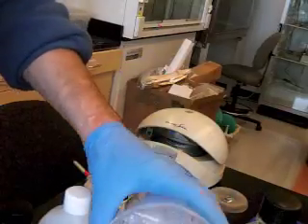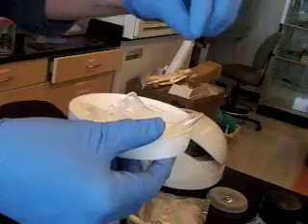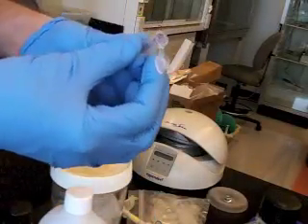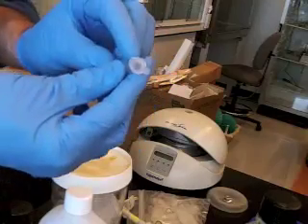And instead, it's good to spill a couple of these out, and then pick one up without touching the other ones. You can pour the other ones back in, like that, and then it's good, if you're not going to use it right away, to cap it. Maybe you want to label it. It's always good to cap it and label it.